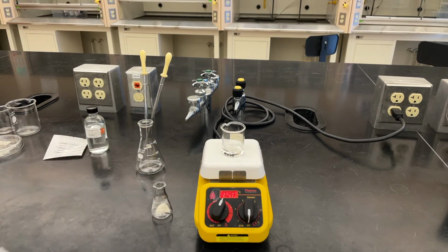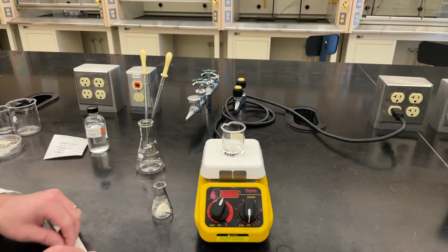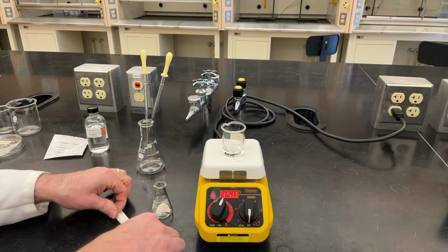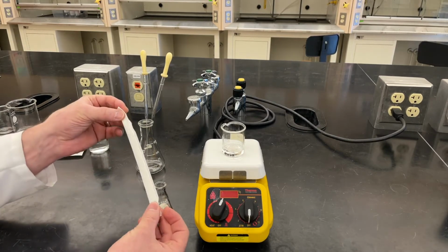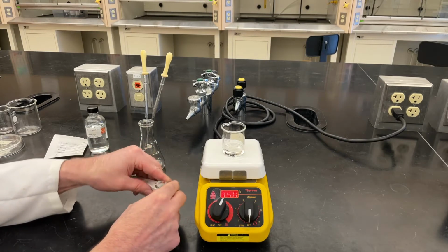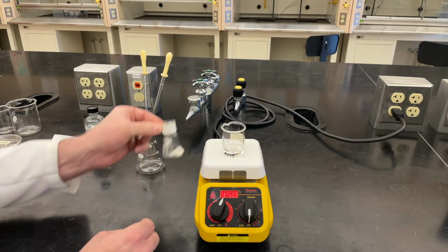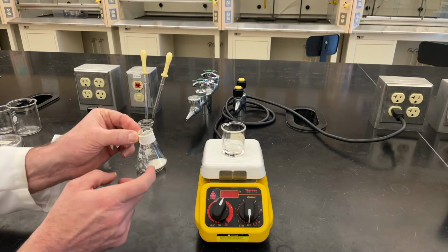But they get a little hard to hold on to as they get hot. And so what I'm going to do is make a little collar out of some paper towels. I'm just folding up a little piece of paper towel to make a little band that I am then going to put around the top and give it a little twist. And now I've got a little twist tie to be able to hang on to it so that it doesn't get too hot in my hand.